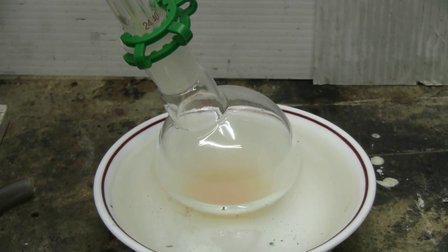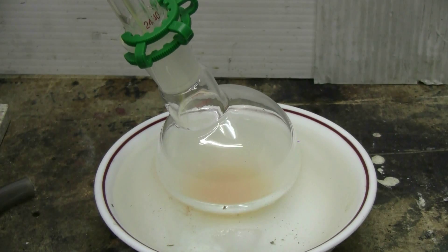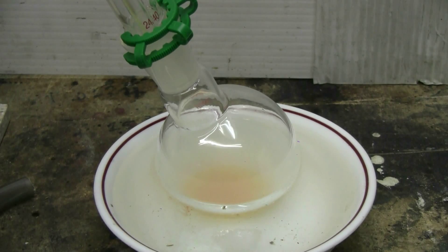This has been running for about 10 minutes now and distillate can still be seen entering the collection glass. I'll probably be heating this thing for another 15 or 20 minutes.